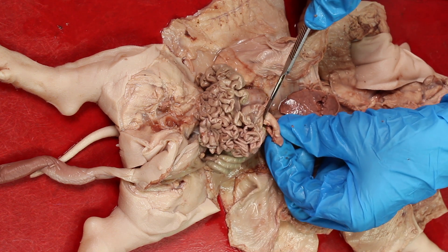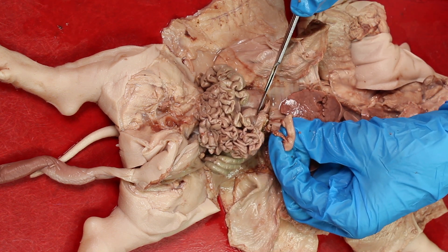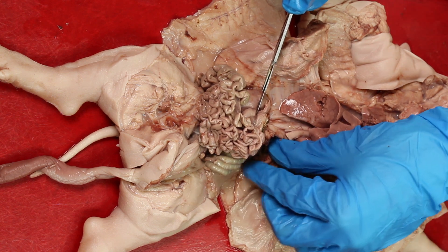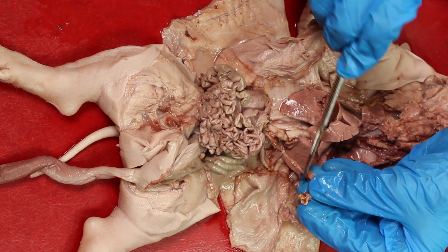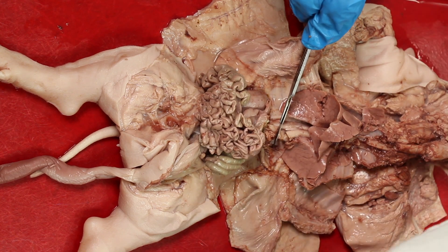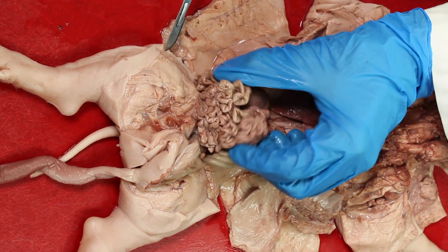Here we are removing the duodenum, the first of three segments of the small intestine. Recall that the small intestine gets its name from the diameter of the tube, which is narrower than the colon or large intestine.